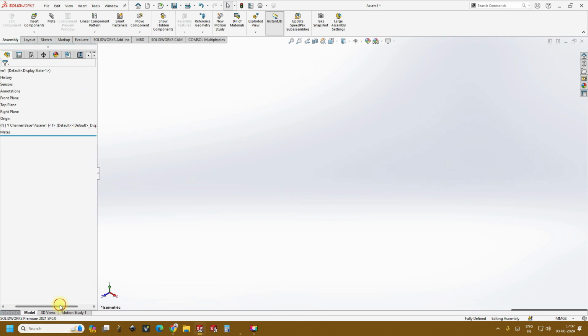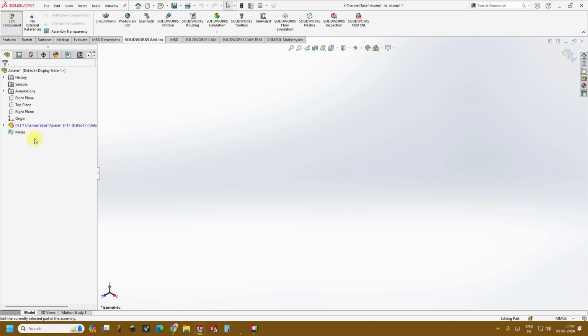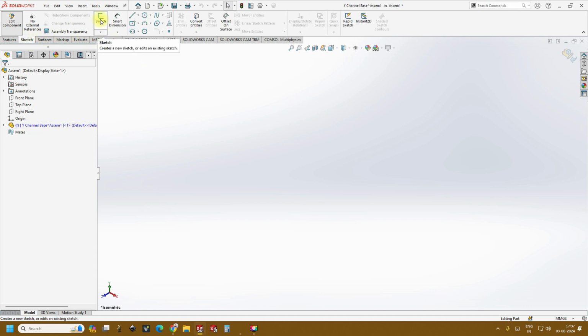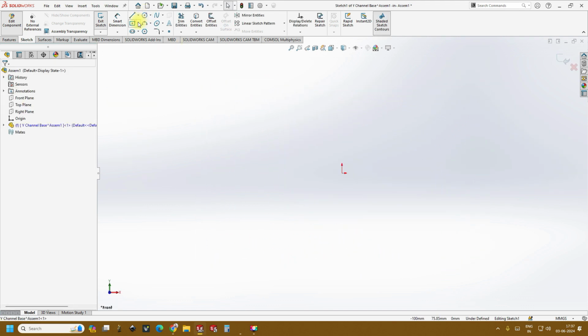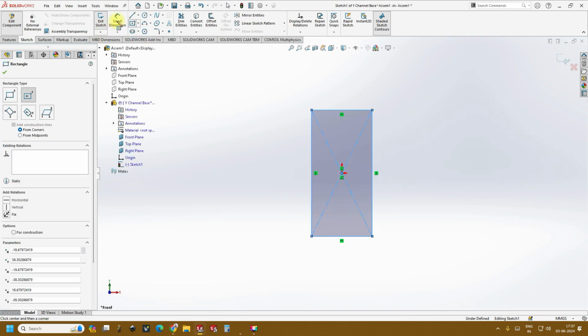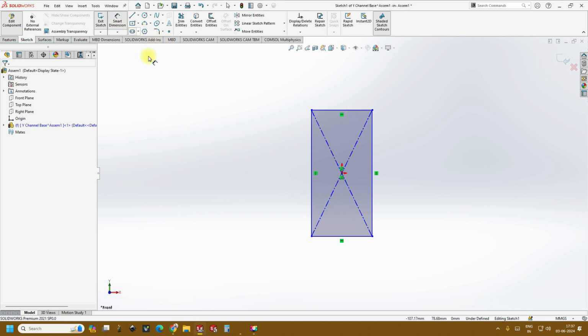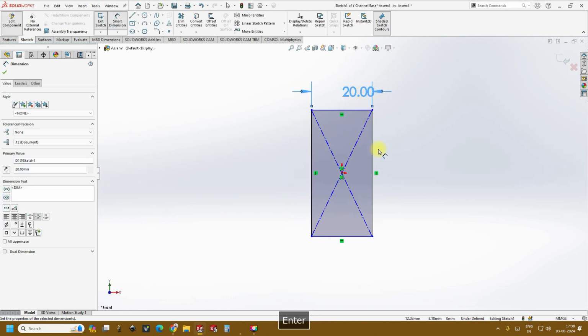Okay, and then just right click, or you can see this part, edit part option. Click on the edit part, followed by go to sketch, click on the sketch and select the plane that you want. For example, in this we select the front plane. You can do the same thing from here. You can select the front plane, and then for now let's create a rectangle of 20 mm cross 40 mm.